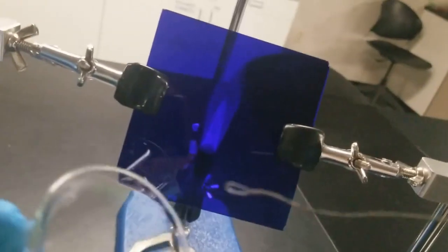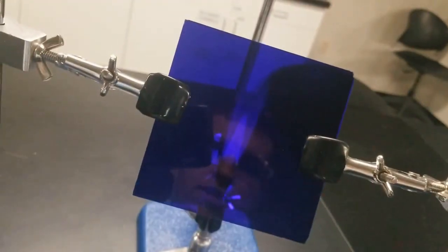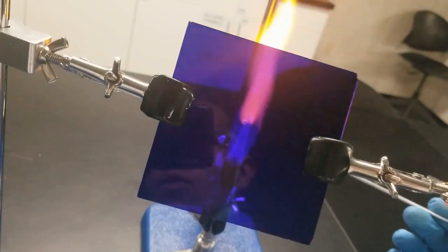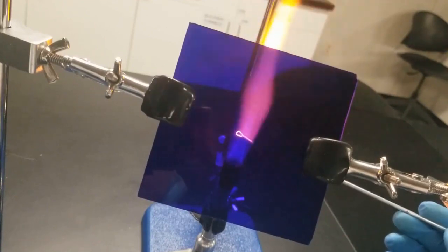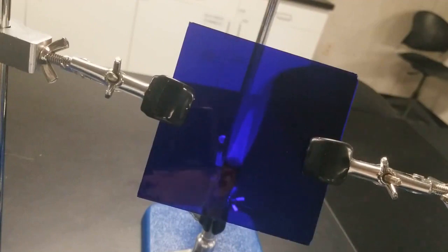All right, so we got our known here. Whoops. Going to dip the inoculating loop in here. Remember, our known should have the potassium, so we should see this lavender flame here. As you can see, a nice bright lavender flame, as would be expected. Next thing up is to wash this off with HCl a bunch of times. So let me just show you one run through.